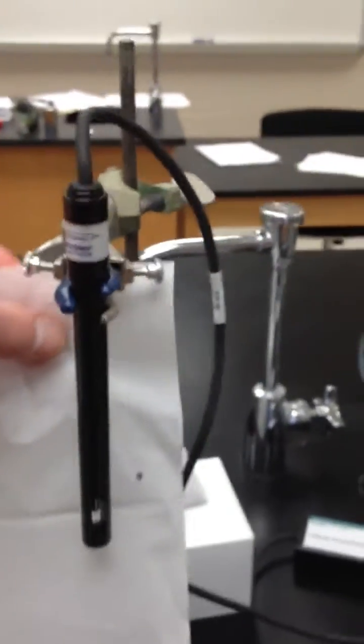This is your conductivity probe, and what you'll notice is the actual sensor is encased inside that plastic protective sheath. You want to make sure that sensor is completely covered by your liquid when you perform this lab.